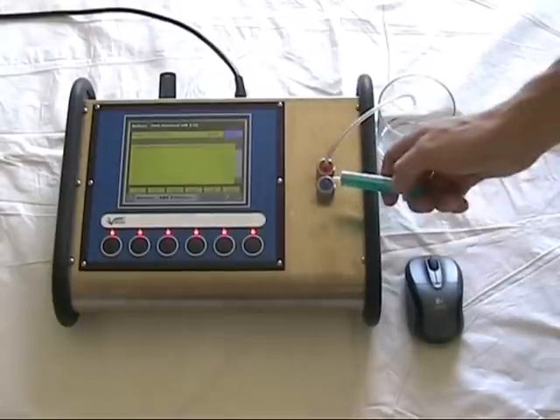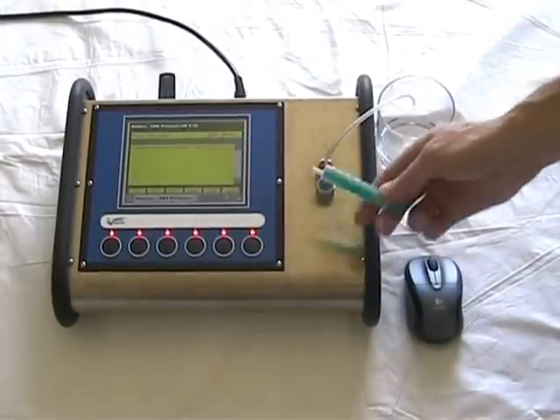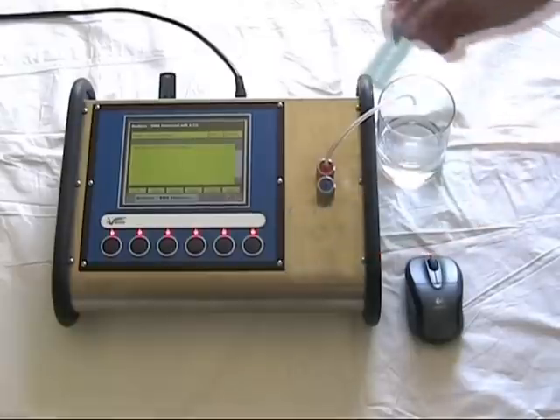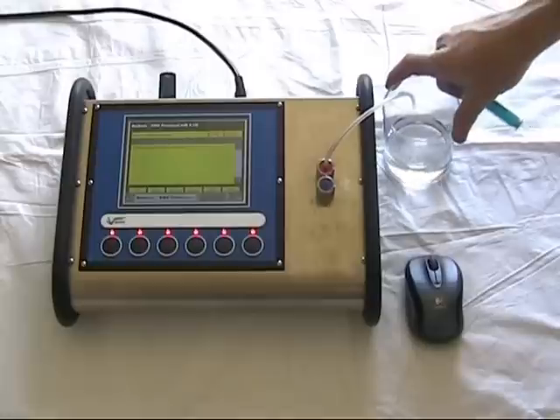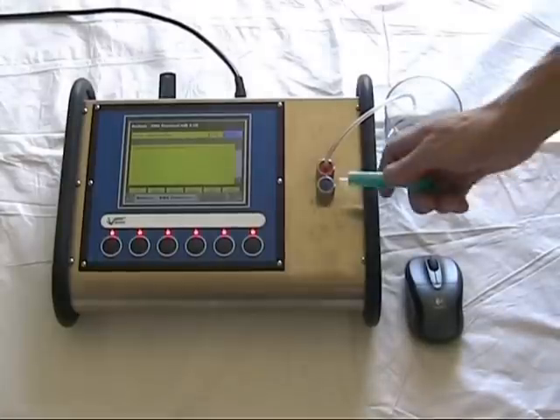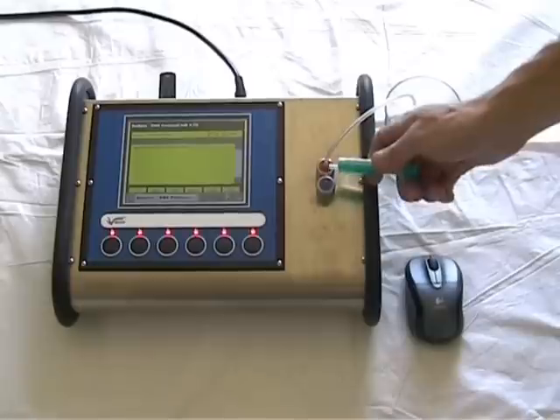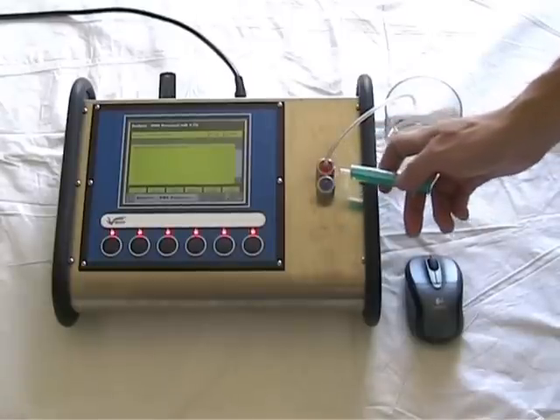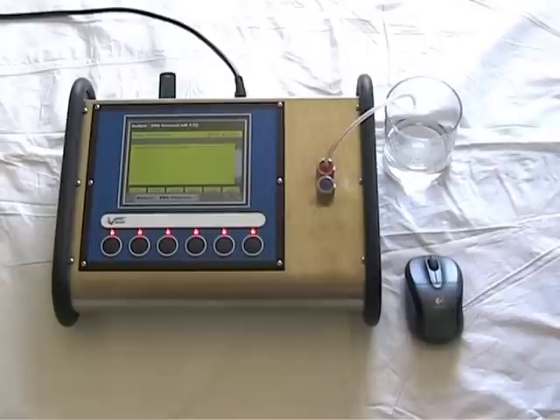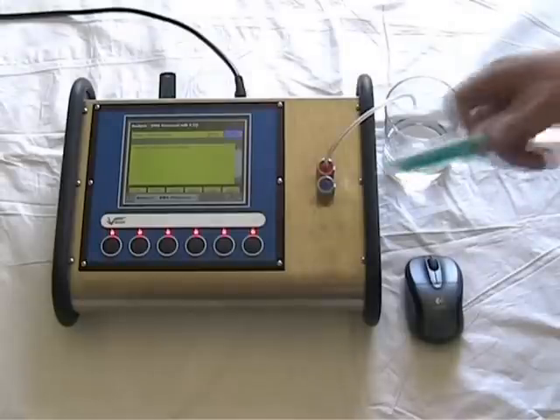The sample is injected to the input using a syringe. It flows out the output and drains into a receptacle. The measurement cuvette is in between the inlet and the outlet and holds a volume of approximately 1.5 ml of milk.